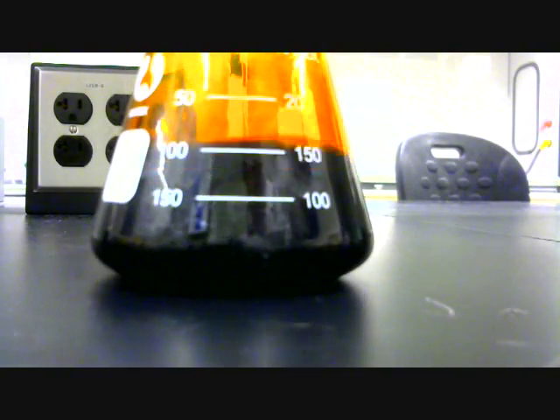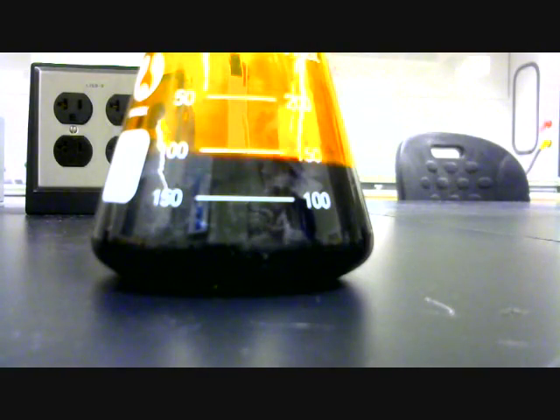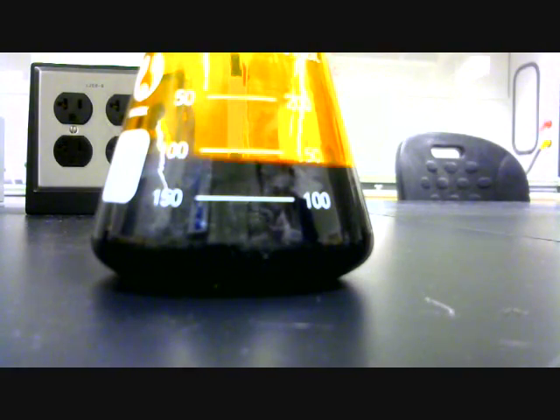The reaction is promoted by base, so I add concentrated sodium hydroxide solution. To avoid adding too much, I add a little at a time, swirling in between.